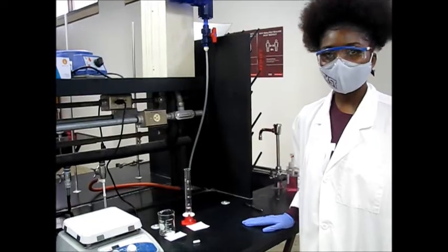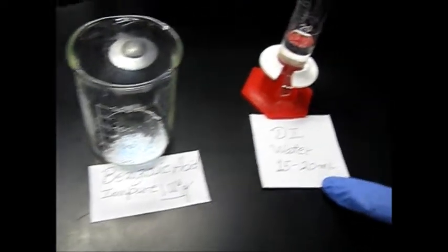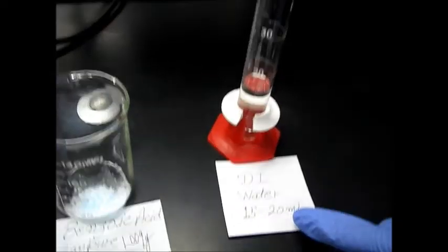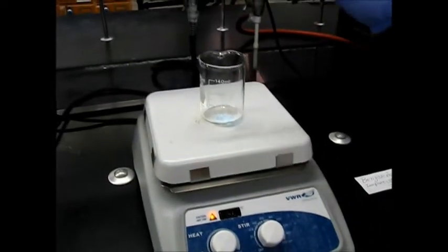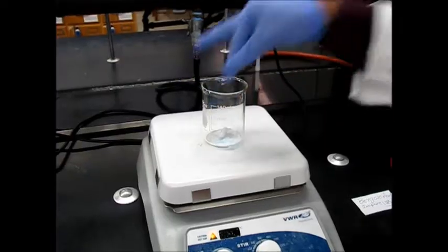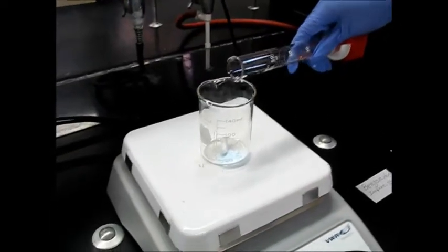It's now time to start the recrystallization process. Here I have my impure benzoic acid, and then I have 16 milliliters of DI water, which you can use 15 to 20 milliliters. I'm going to place it onto the hot plate. I'm going to put in my magnetic stir bar. Then I'm going to pour in my 16 milliliters of water.